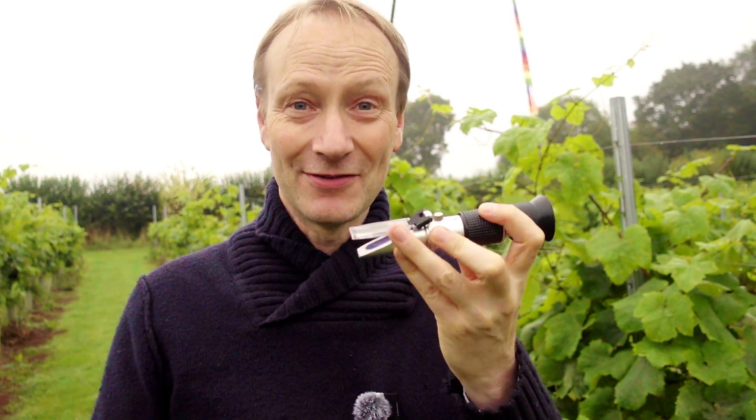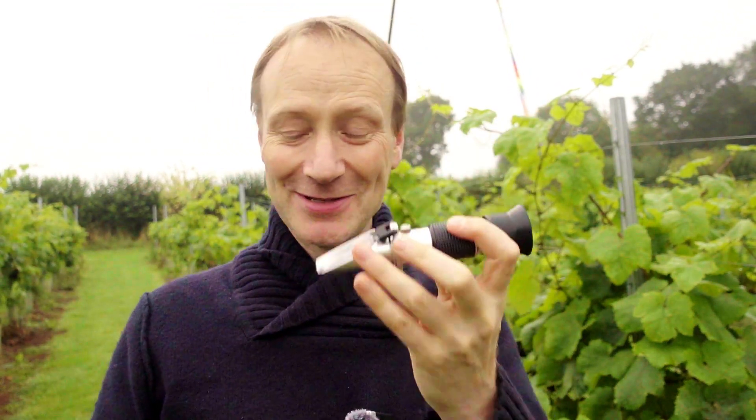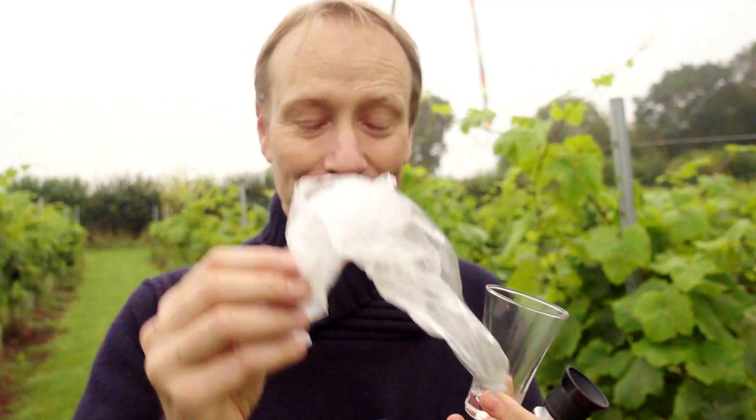Back to the main purpose of this video: how to use this refractometer properly. All you'll need is a refractometer, a little glass, and a bag. What we're going to do is choose about 20 or 30 vines at random and pick random grapes off the vine as well. The best way to do this is to do three paces up the row, pick a vine, close your eyes or look away, and just pick two or three grapes off the bunch.